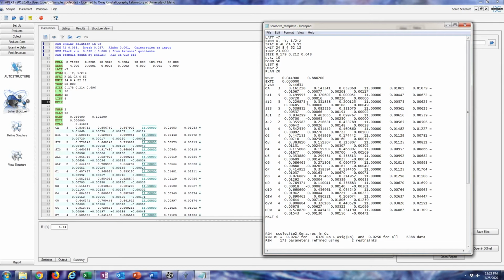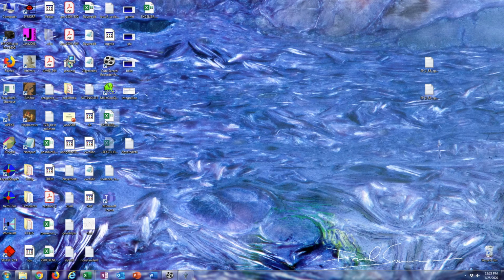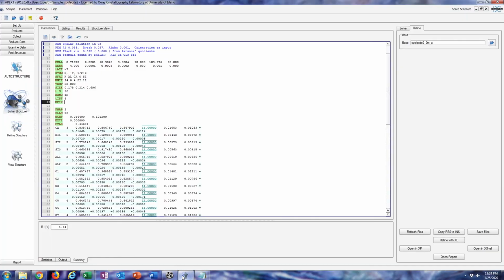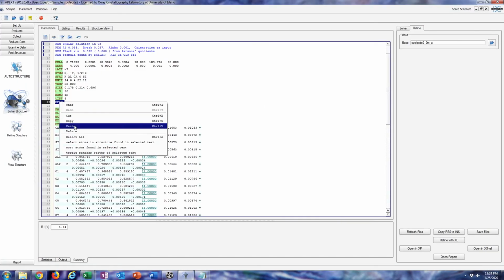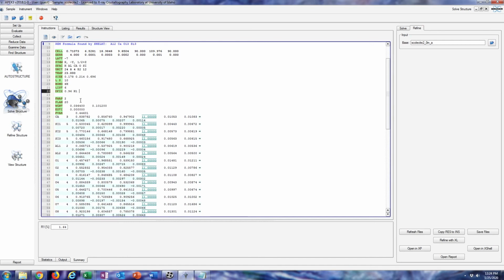And I'm just going to use the default standard deviation. So all I have to list is DFIX, and then the bond length, which is 0.96, and then enter the atom that the hydrogen is bonded to and the hydrogen itself. But just to remember, this is what I did before. I'm just going to copy this. DFIX 0.96. It'll still probably be a little close to the oxygen, but that's okay. I'm fine with just using the regular standard deviation.